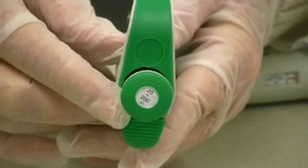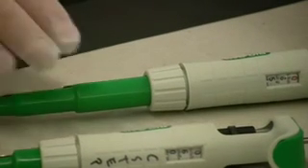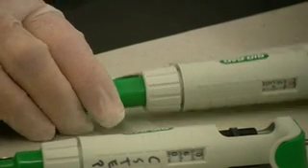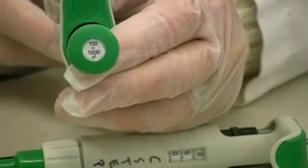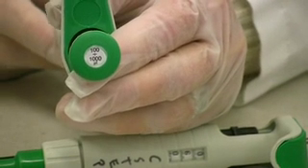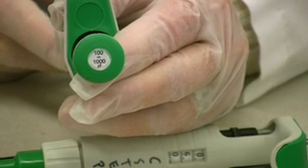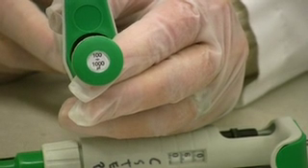This means that the volume you can transfer is anywhere between 20 and 200 microliters — you cannot exceed those limits. This particular micropipetter is called a P1000, because the range is between 100 microliters and 1,000 microliters, or 1 ml.